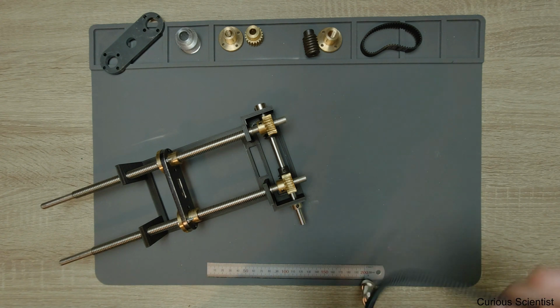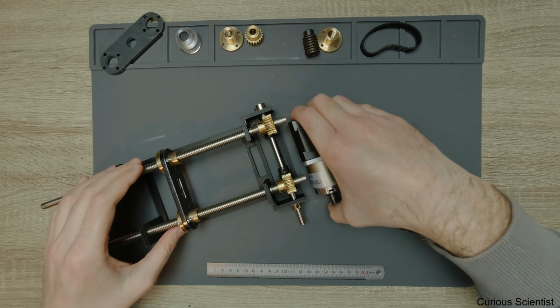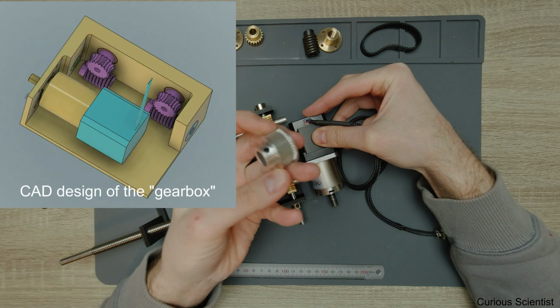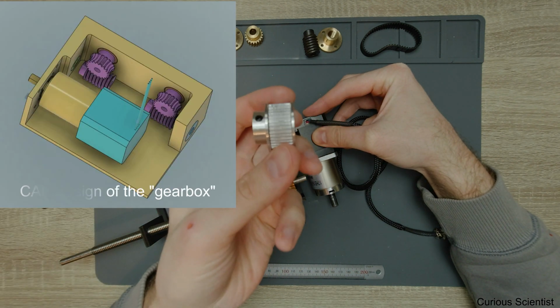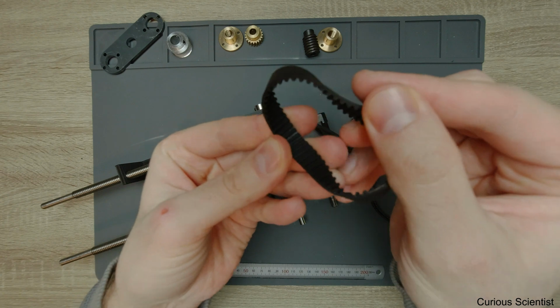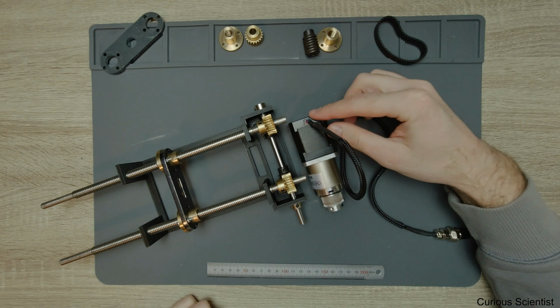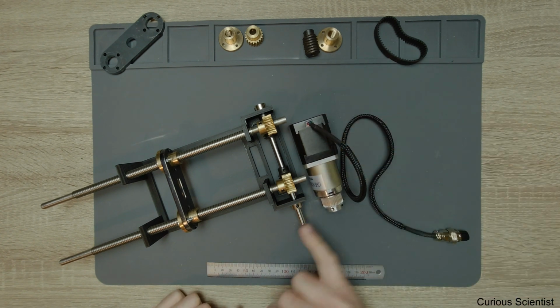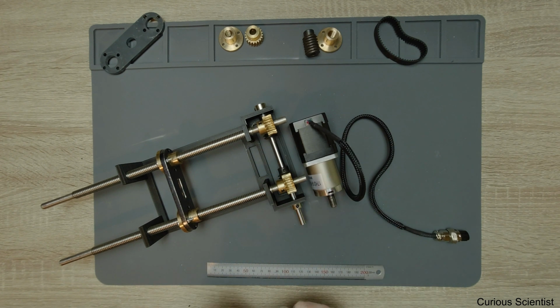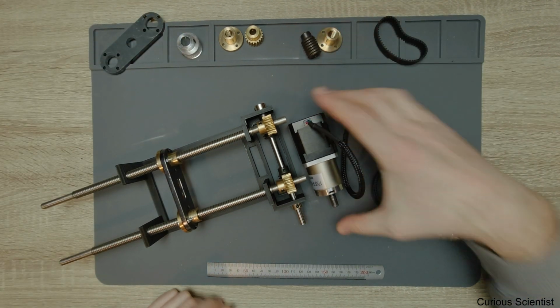And then we will put the motor, so we will use one of the stepper motors like this, put quite close to this part, so it will be placed something like this, and then I will use these 9 or 10 millimeter wide timing pulleys and these type of belts as well. So this will be connected like this with 1-to-1 gear ratio, so I will not use any reduction between the main shaft and the motor, only the planetary gear will be there. And that's all. So this will be quite short.